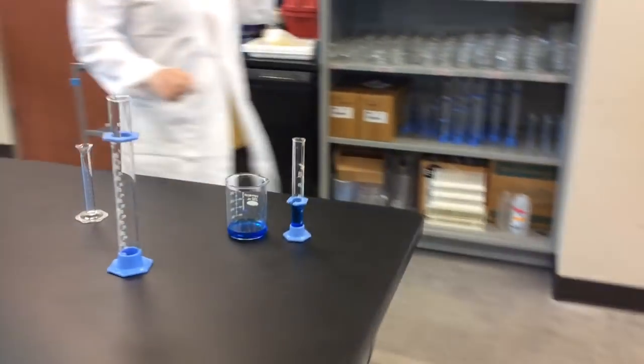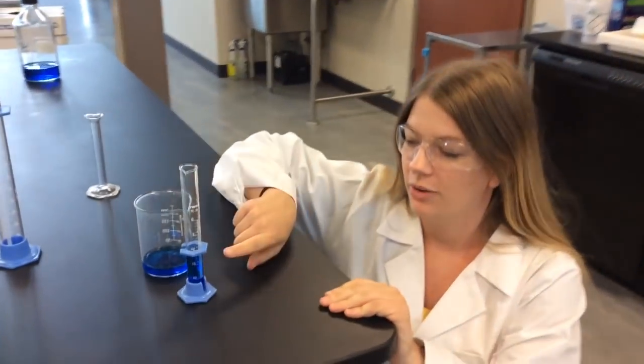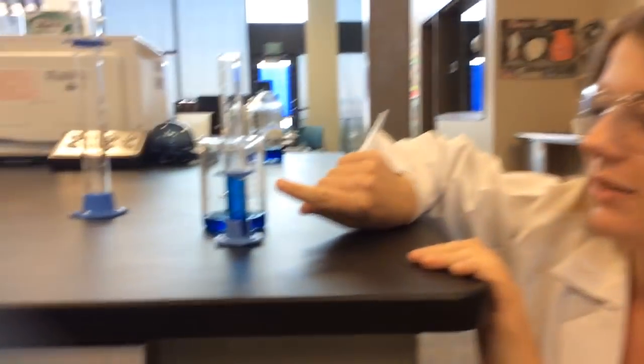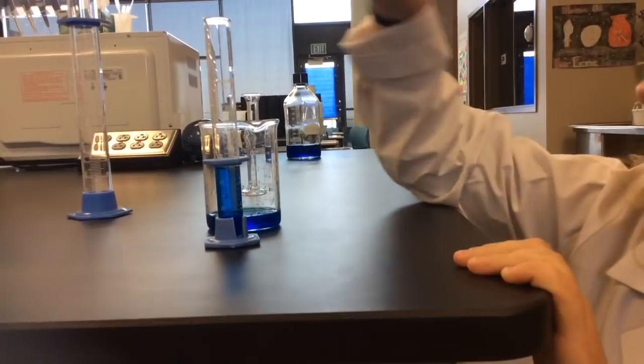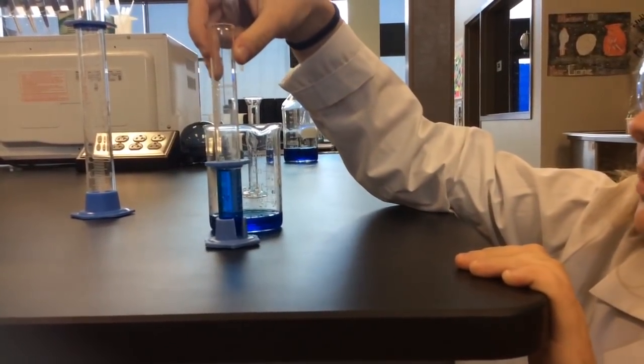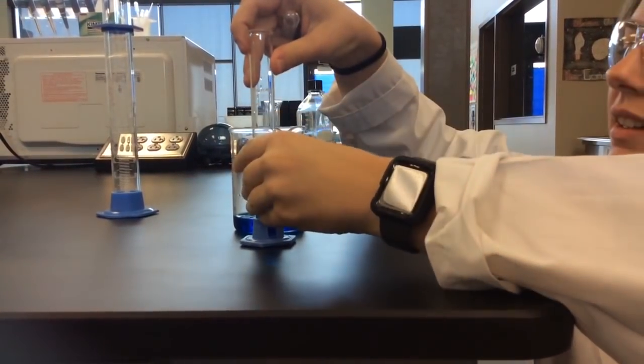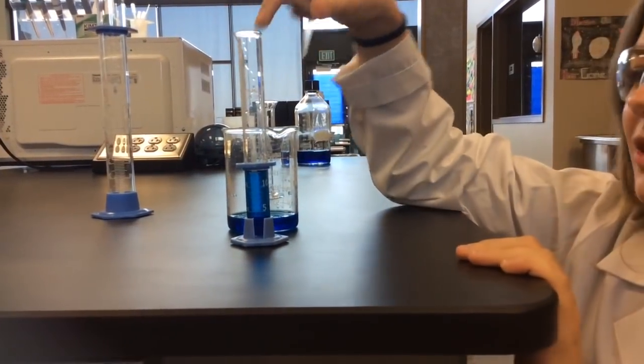When measuring this, it's a really good idea to pour really close to the measurement that you need. So I did not go all the way to the 10 milliliters over here. I'm doing this backwards, actually. We're measuring, my bad, 15 milliliters.